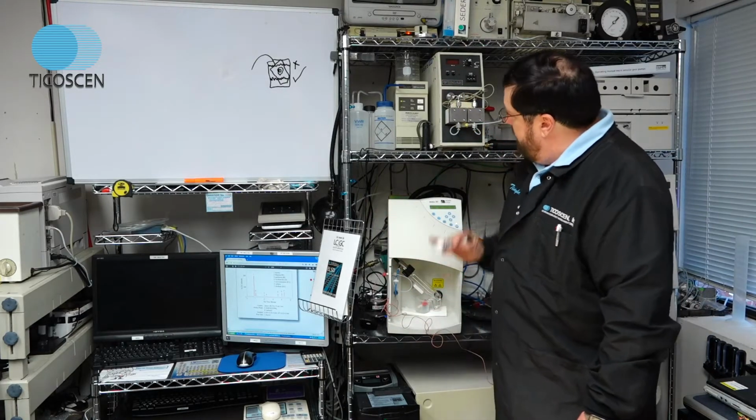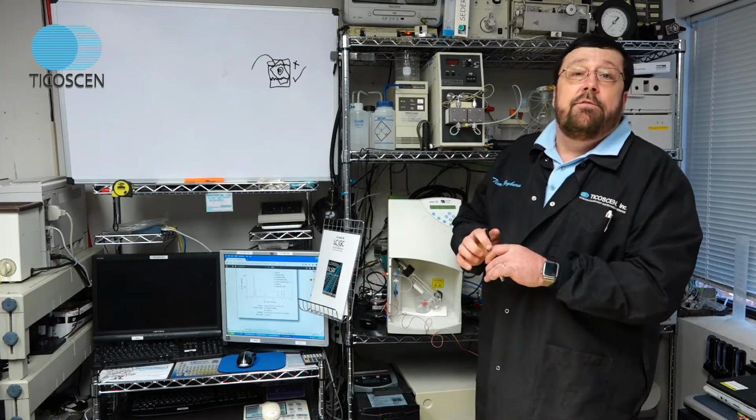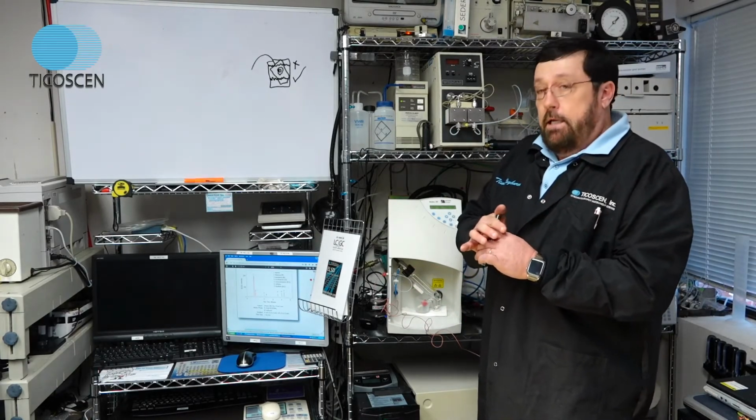Provided your drain lines and your exhaust lines are not blocked, more than likely it's your nebulizer affecting your RSDs and LODs.